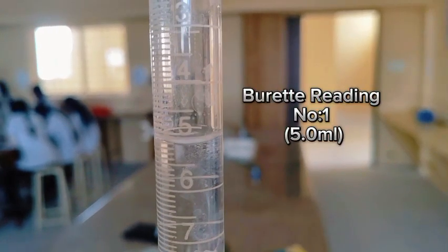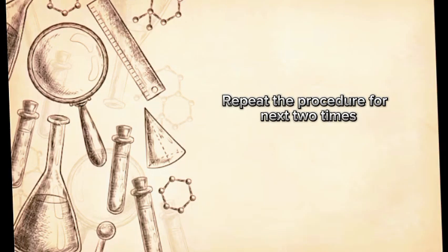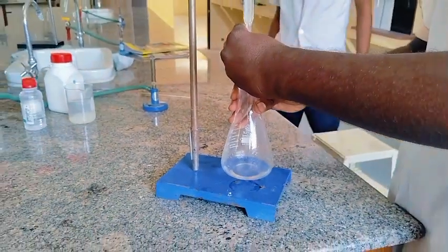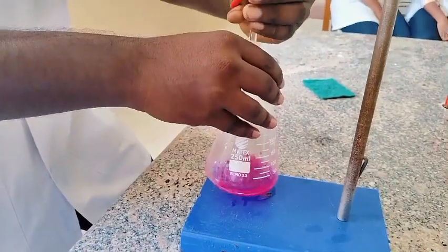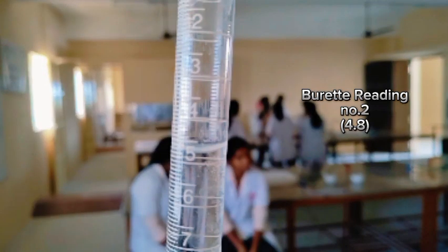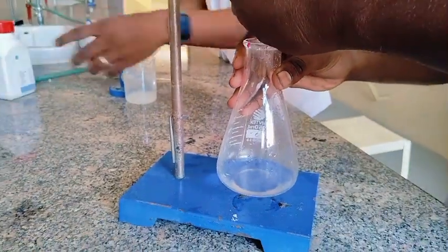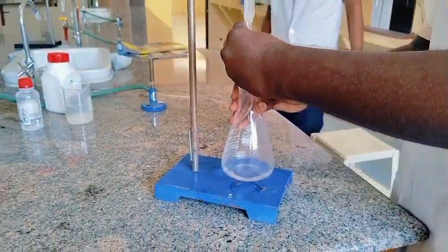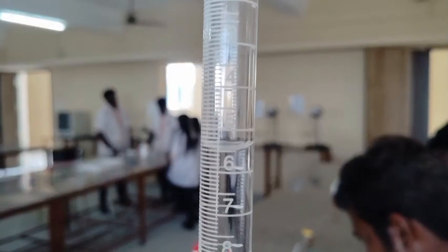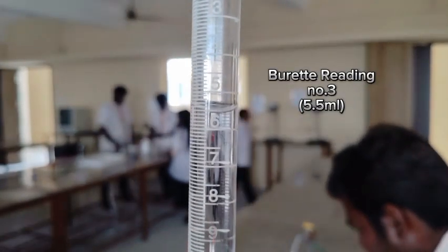Burette reading number 1: 5.0 ml. Repeat the procedure for next 2 times. Burette reading number 2: 4.8 ml. Burette reading number 3: 5.5 ml.